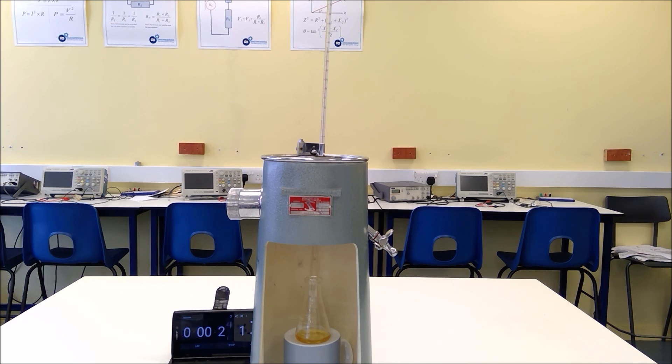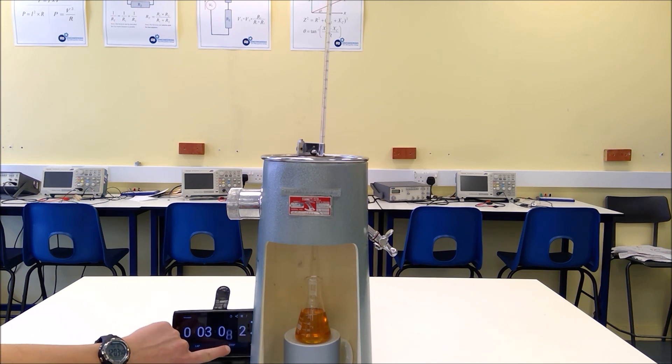As we would expect, the oil appears to be flowing more quickly through the orifice because as the temperature has increased the viscosity has decreased slightly. Already we're at 20 millilitres, just coming up to 30 millilitres, and the temperature of our oil is still at 55 degrees. Now we're just passing 40 millilitres, and as we come close to 50 millilitres I need to ensure that my eye is in line with the index mark — and there we have 50 millilitres.